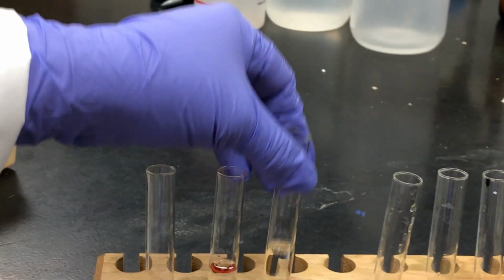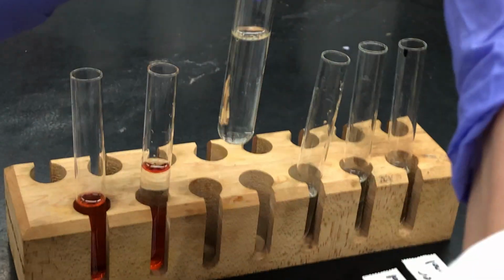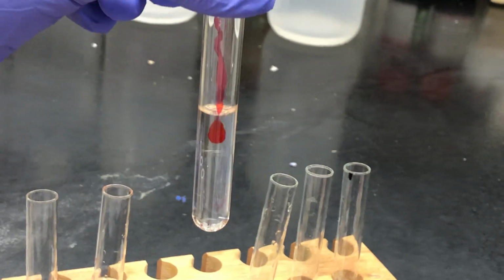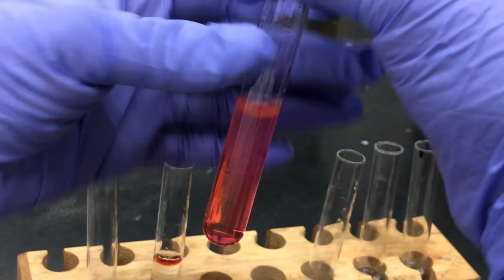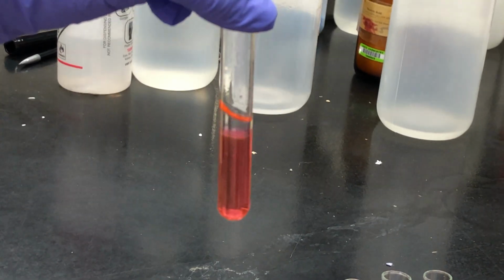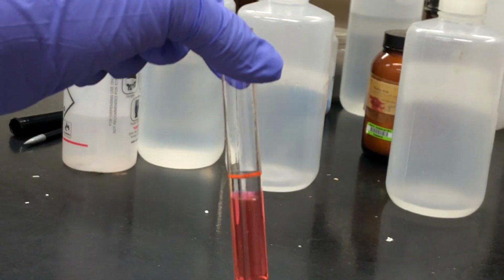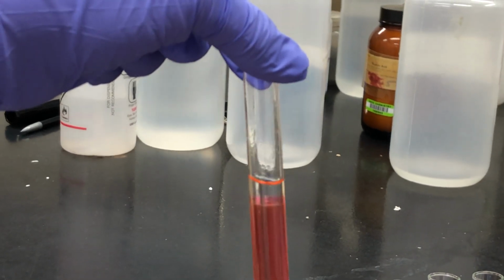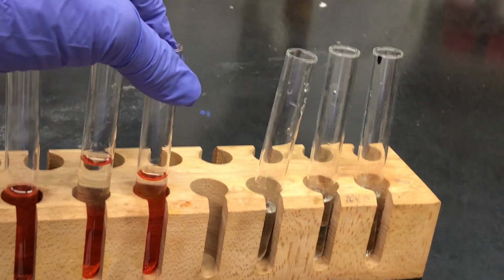And the third experiment is pentane and methanol. So we're going to add, again, food coloring to the methanol pentane mixture. It's a little drop there. We do the shaking. It takes a little longer, but once it settles, you can see that pentane and methanol do not mix. One of the liquids is completely colorless. It has no dye in it, no red color, whereas the other one has the pink color from the food coloring.